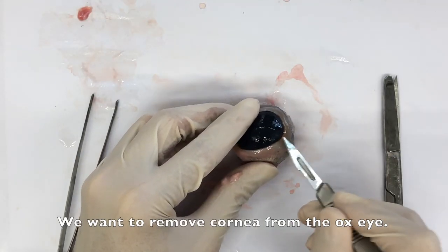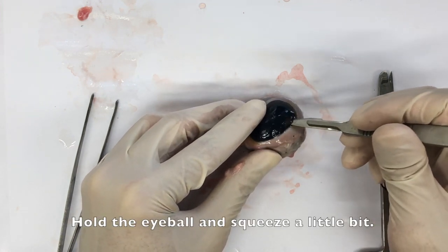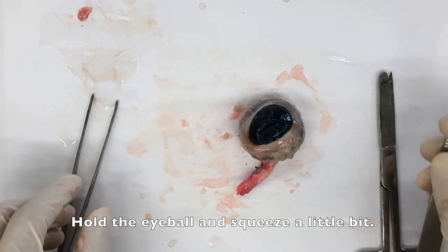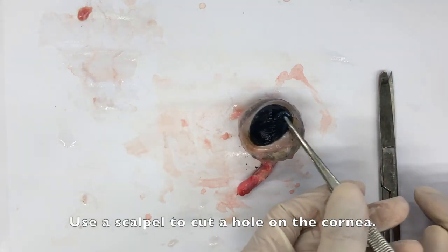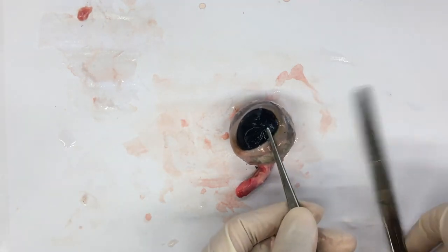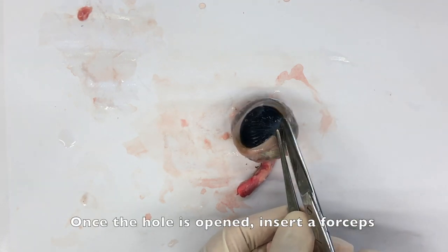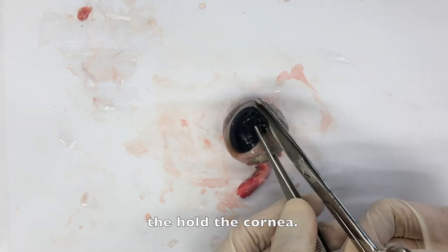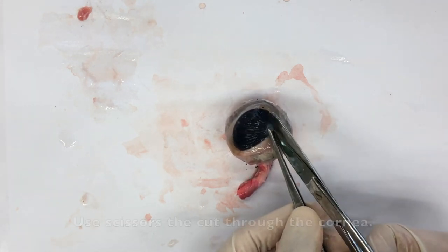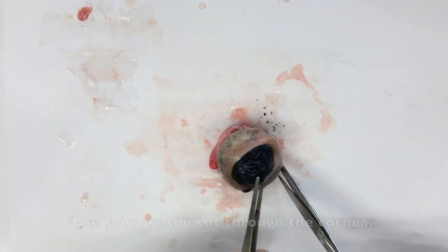And now, we want to remove the cornea from the ox eye. You can hold the ox eye like this and squeeze it gently. Then use a scalpel to cut a hole like this in here. Once the hole is opened, insert forceps in it. You can use the forceps to hold the cornea, and use the scissors to cut a circle around the cornea.